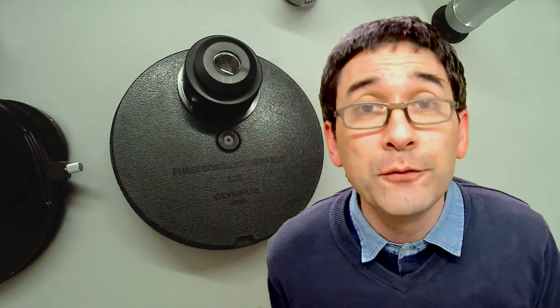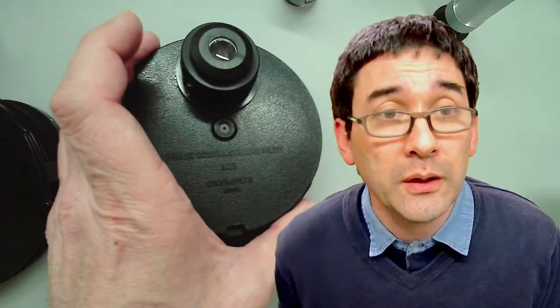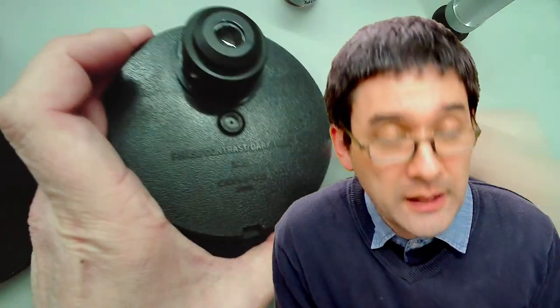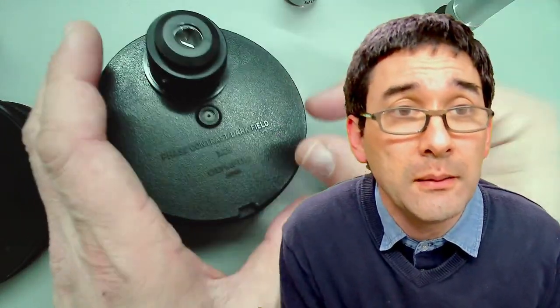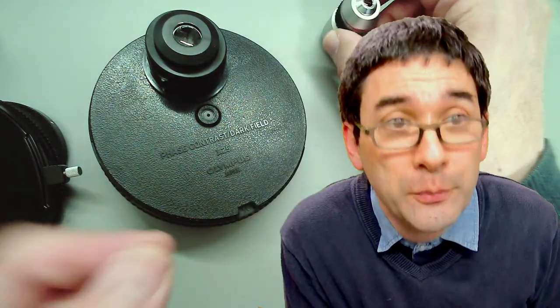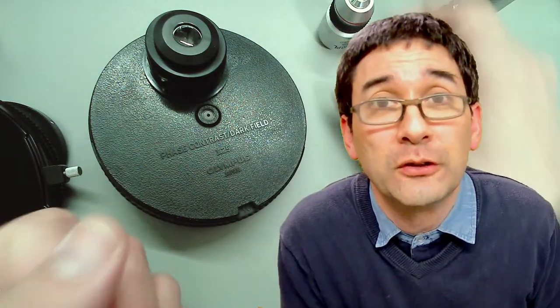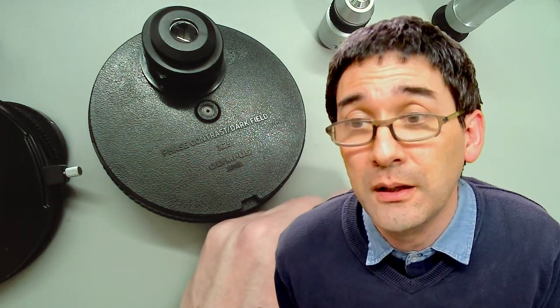If there are upgrade kits, first check that they work for your specific microscope. Very often the condenser will either be a rotating turret type, or you'll have separate filters to put in manually each time you change magnification — not as convenient, but also possible.